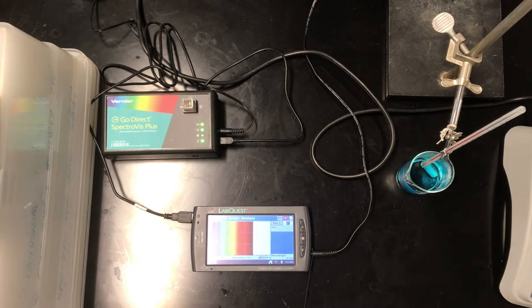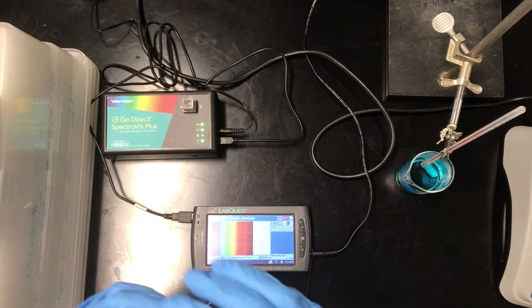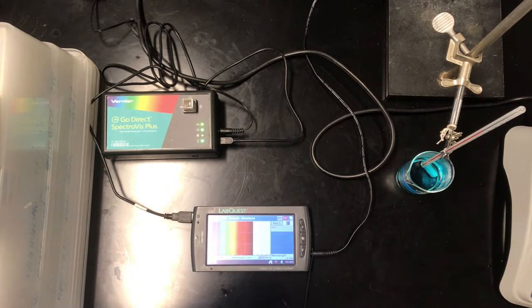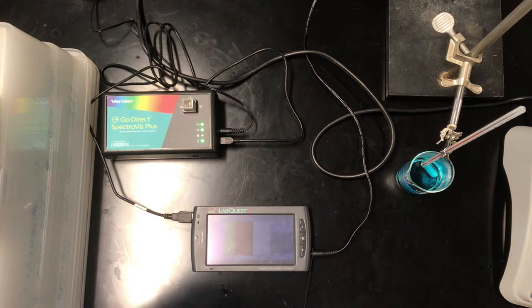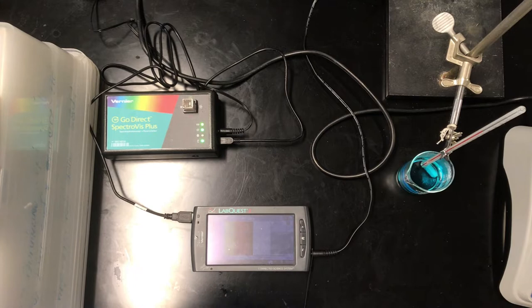All right, welcome back everyone. In this experiment we are investigating the reaction between cobalt 2 plus and chloride anion in aqueous solution. Specifically, we're interested in the temperature dependence of the equilibrium constant.